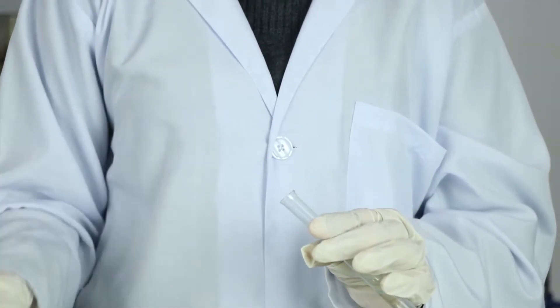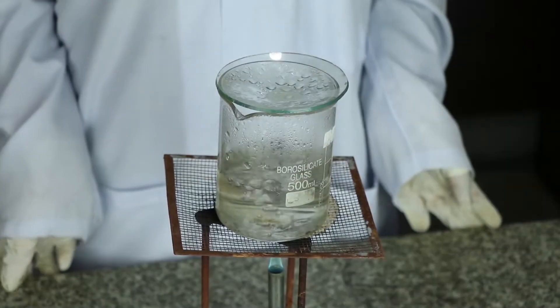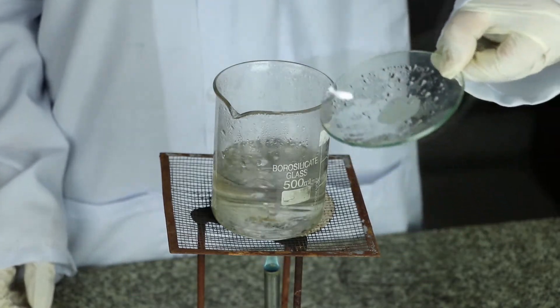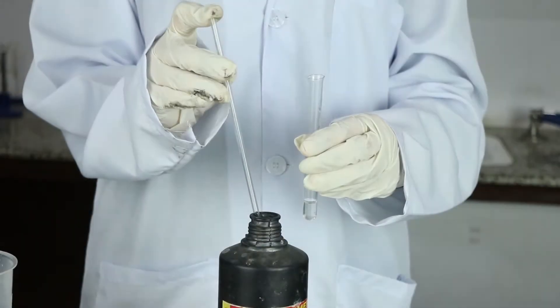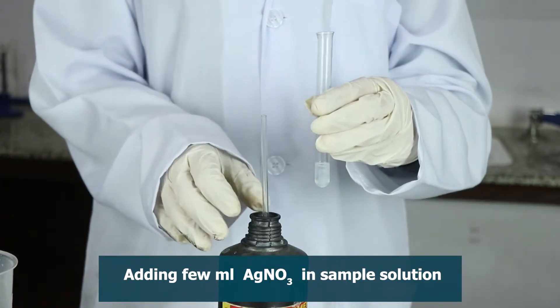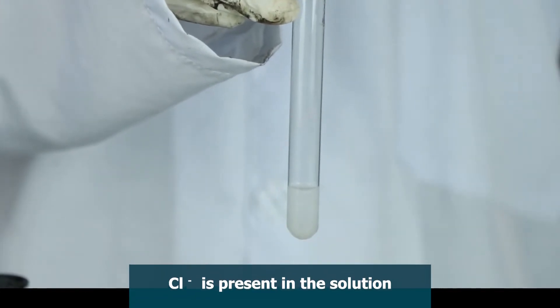For the residue test, evaporate a little sample solution on a watch glass kept over a beaker half filled with water. Solid residue obtained after evaporation showed that water contains solid particles. Take a few ml of sample solution in a test tube and add a few drops of silver nitrate solution. The white precipitate proved that chloride is present in the given solution.